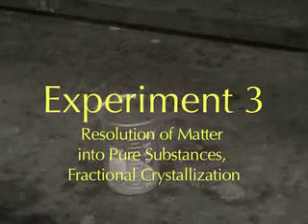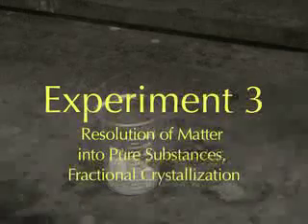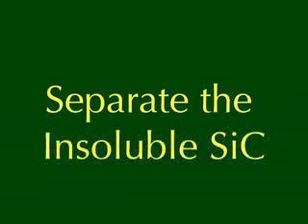Experiment 3. Resolution of matter into pure substances using fractional crystallization. We start with a mixture of silicon carbide, potassium nitrate, and copper sulfate.